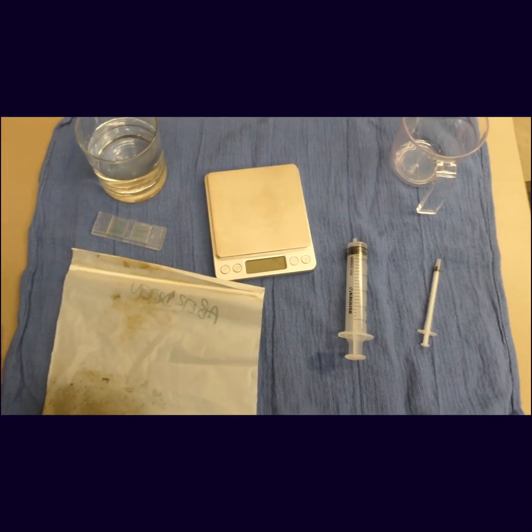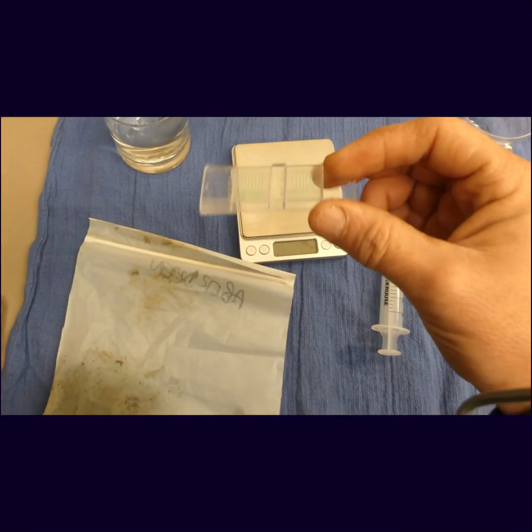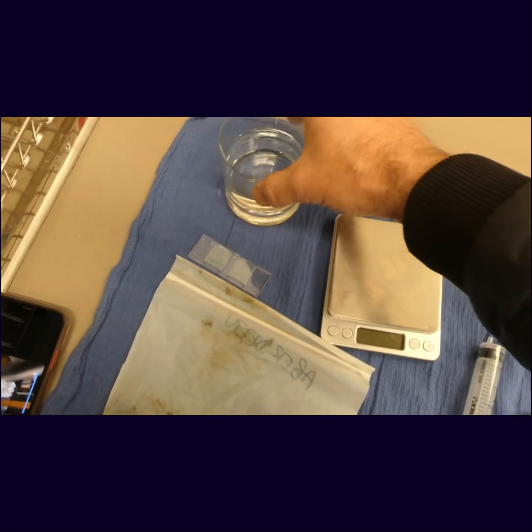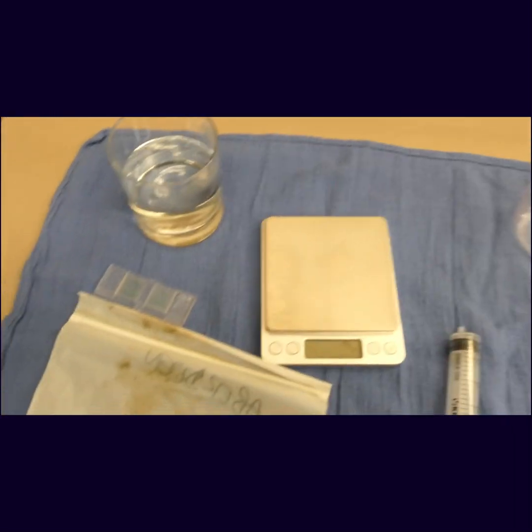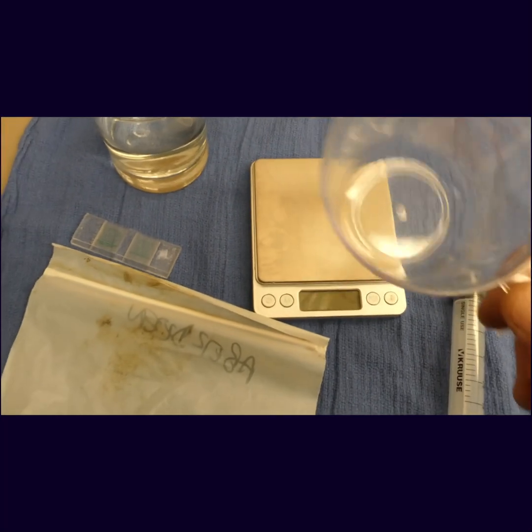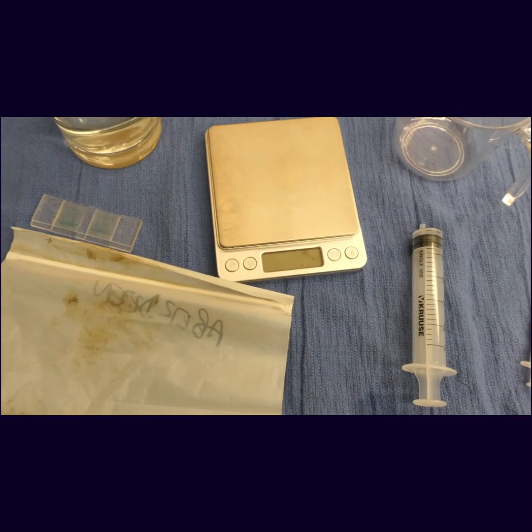We have a few important things here. One is our sample, and two is this special slide we use to count the eggs — it has a green line on it so we count the eggs within that small area. Then we have this solution that looks like water but it's actually magnesium sulfate, a heavy water, so the eggs will float on top of it. We also have our measuring device — we measure four grams of feces using reusable cups that we wash in between. I'll take you through the process now.